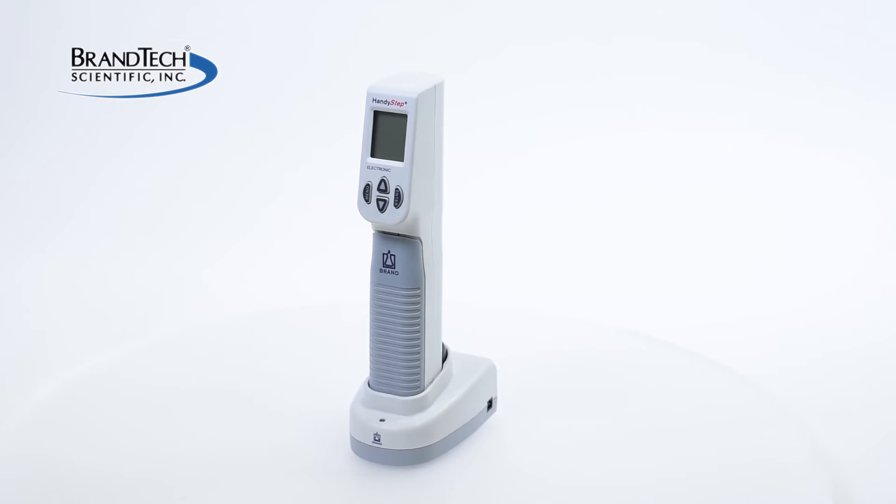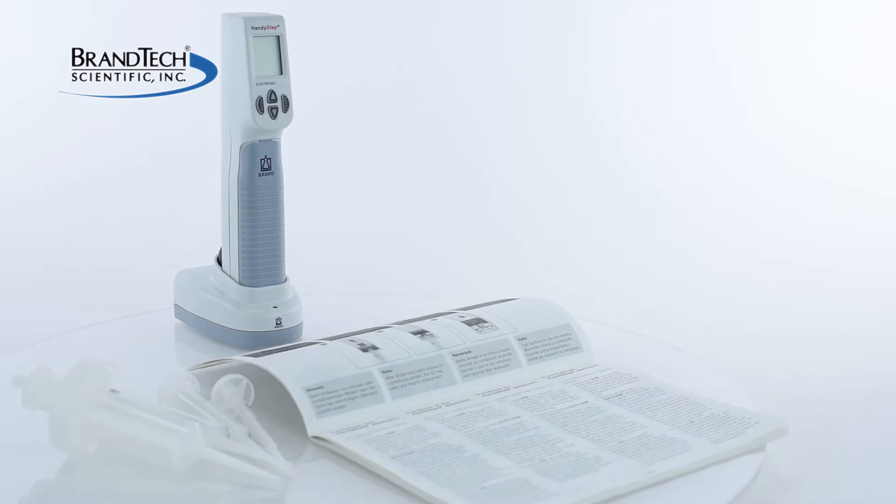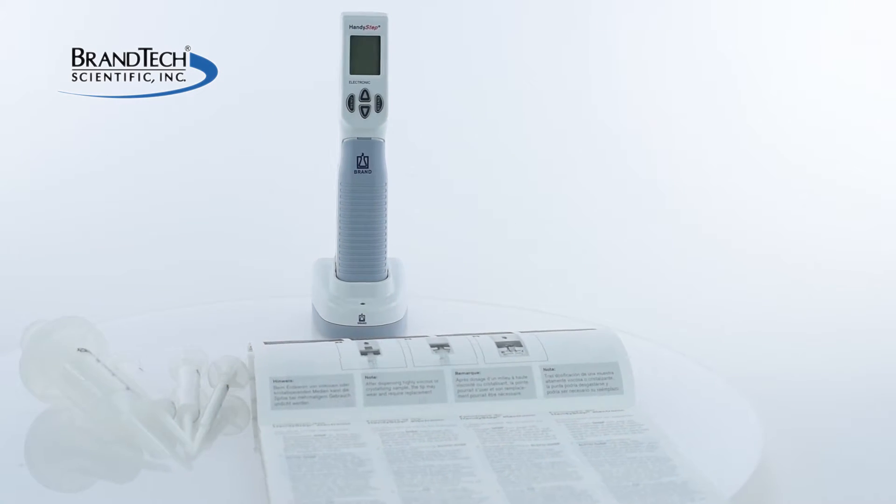This video demonstrates how to clear errors from a HandyStep electronic repeating pipette. It's intended as a general guide and not a substitute for your operating manual.